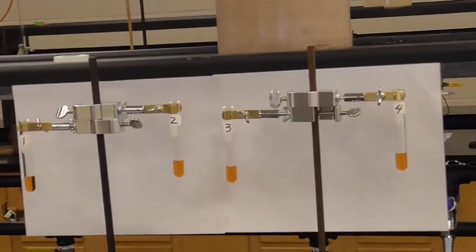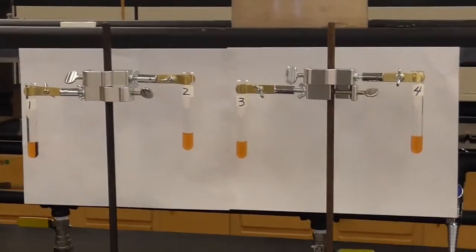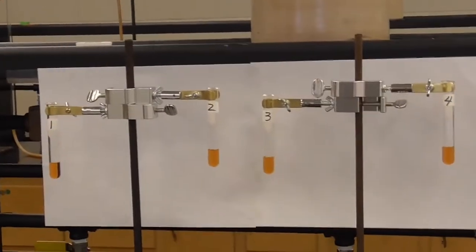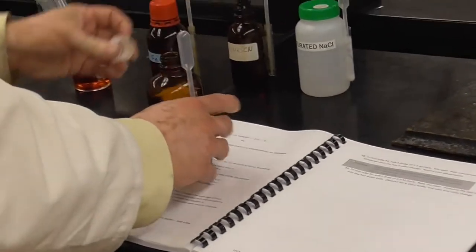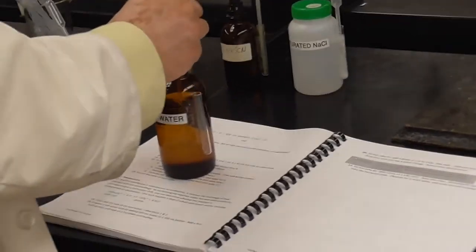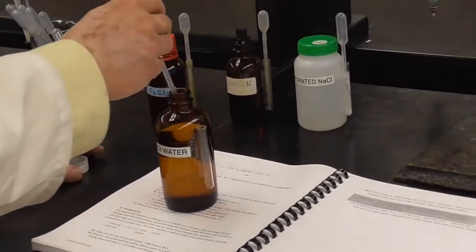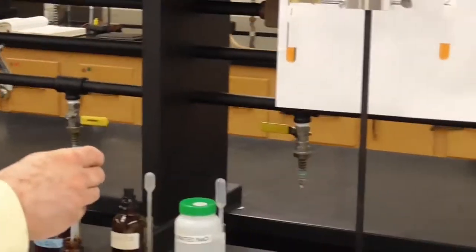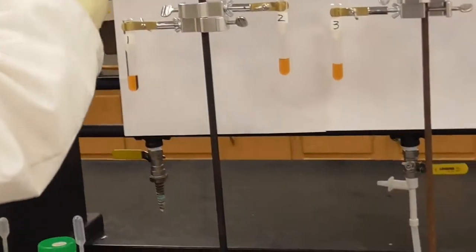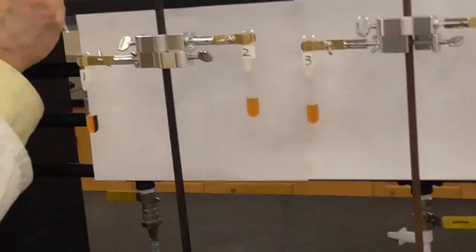All right, let's come back here. And on each one of these test tubes, we're going to try to tweak it. That is to say, we're going to add a little something and watch LeChatelier hopefully cause a shift. The first one, it says add 10 drops of just water. Well, why are we doing that? If we're going to be looking for color changes and we're adding 10 drops of solution, that does dilute it a little bit. And so this orange will whiten just a hair just because of a dilution. So test tube 1 is our control to see what that looks like.